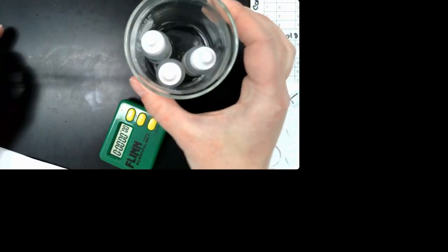Okay, so now we're down here on the cold samples. So we're going to do the same concentrations, but now I have my samples. They've been sitting in a beaker of ice solution. So they're in this beaker, in a big container. The ice has partially melted, but we still have some ice in the big bucket. So these are the same samples. We've got sodium thiosulfate, hydrochloric acid, and water in little droppers, but these have been chilled.